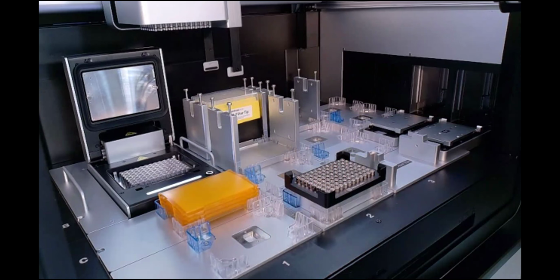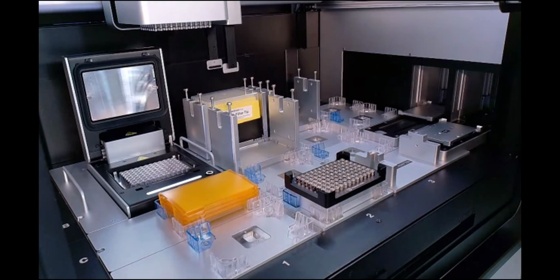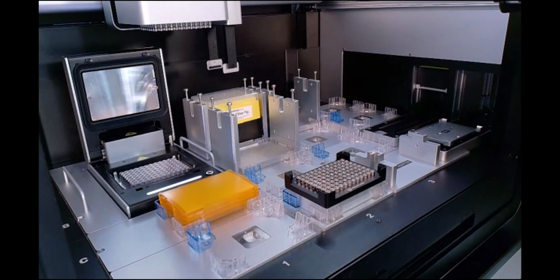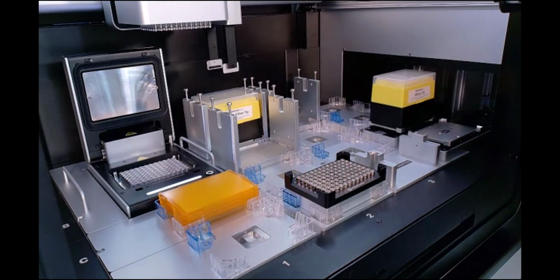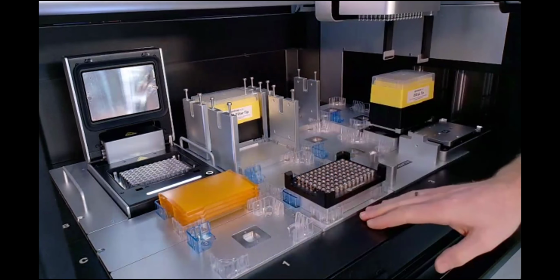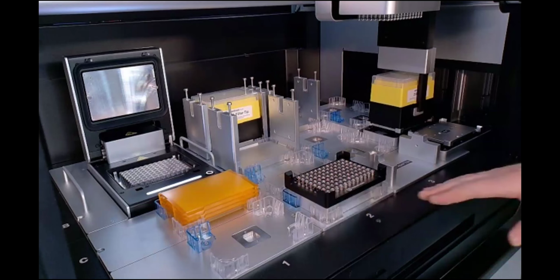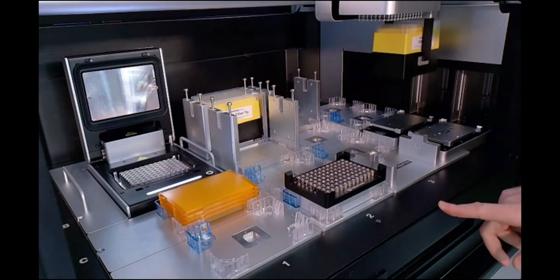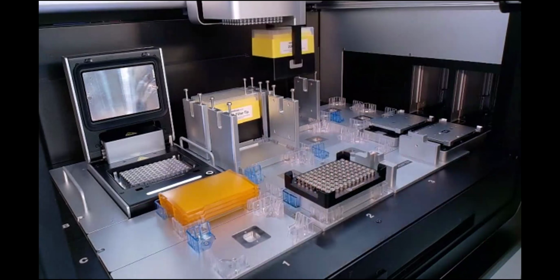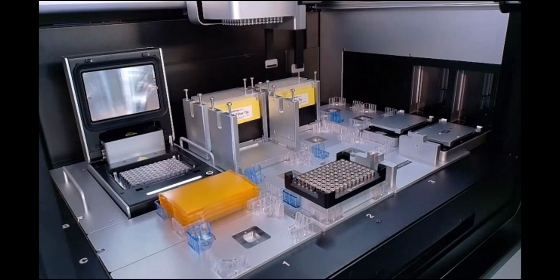A few other things that are on the deck here. In the back left, you can see our fully automated thermocycler. In this protocol, we'll be delivering a plate to it as well as a plate lid. You'll also see the magnetic block in the front here for any of your bead cleanups. I recently removed the waste chute to get it out of the way for demo purposes. But that is able to throw away tips and plates as you're running protocols.